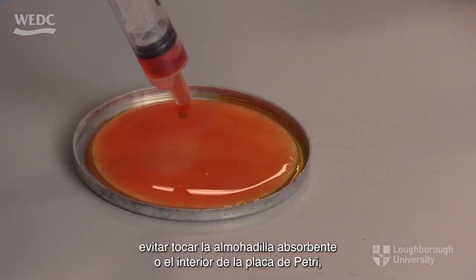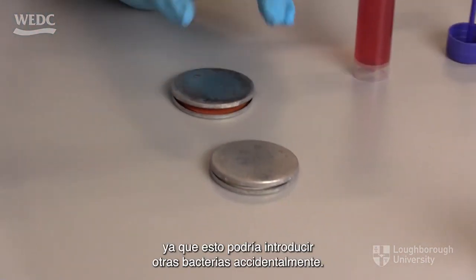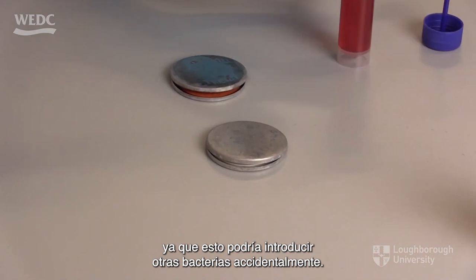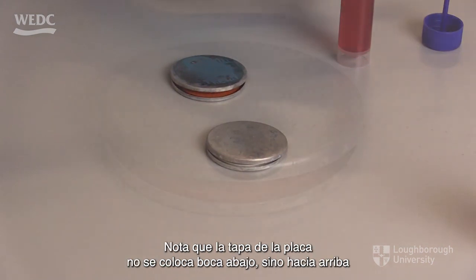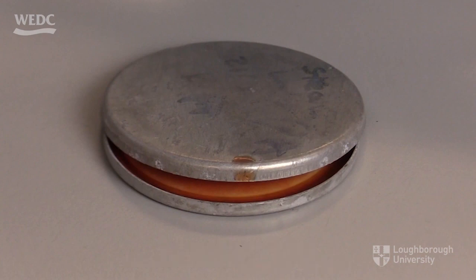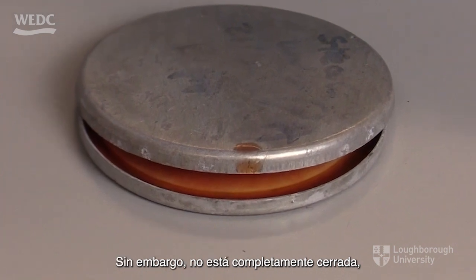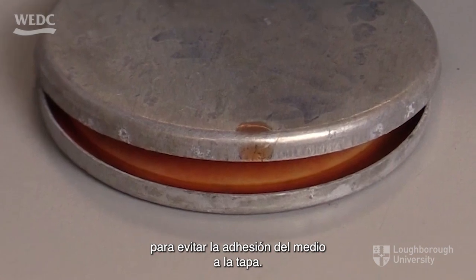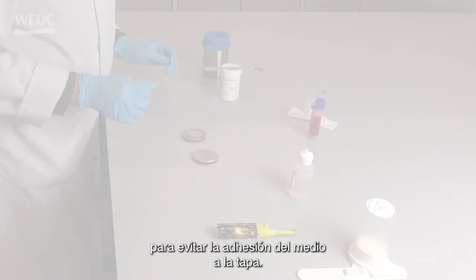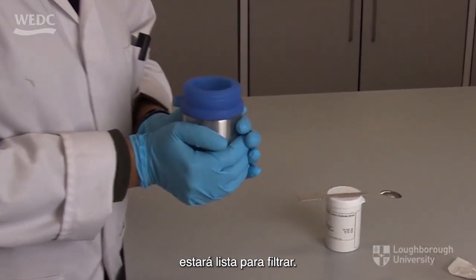It is important to avoid touching the absorbent pad or the inside of the petri dish, as this could introduce other bacteria accidentally. Note that the lid of the dish is not put on upside down, but the right way up, so that bacteria from the atmosphere cannot be trapped inside the lid. It is not completely closed, however, to prevent adhesion of the medium to the lid. When the filtration unit has cooled down, it will be ready to filter.